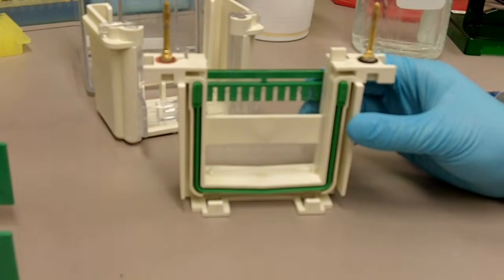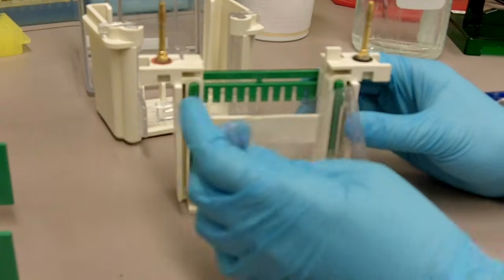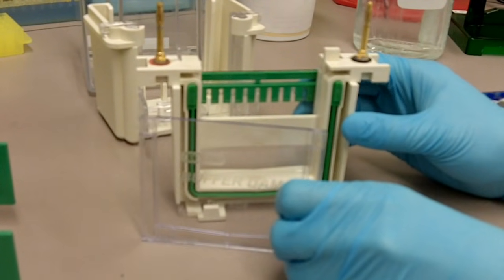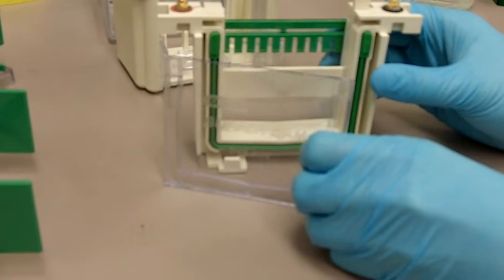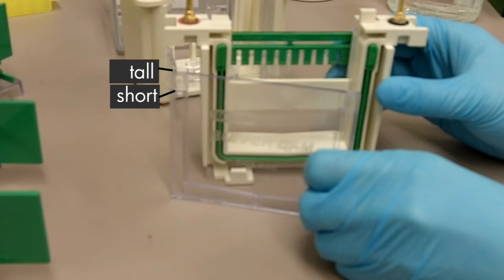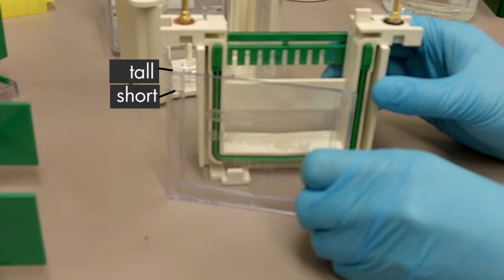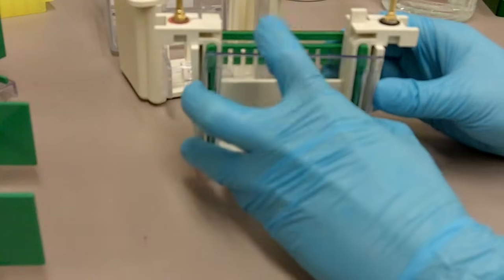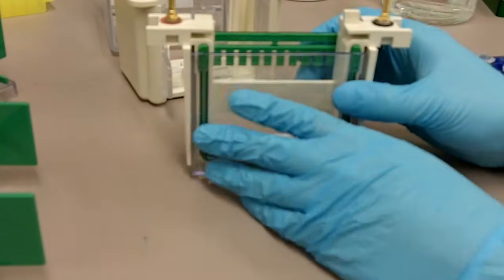Since we're going to run only one gel today, I'm going to use a dummy plate. If you pay close attention to that, you can also see kind of like a tall plate and a short plate on this dummy plate. Therefore we'll flip it over and we'll slide it in like that.